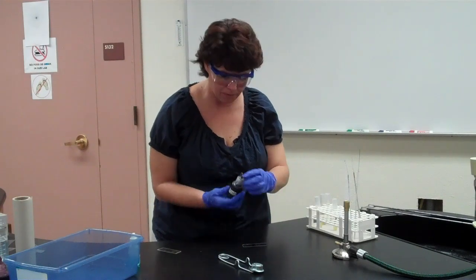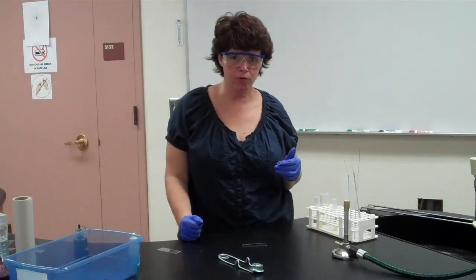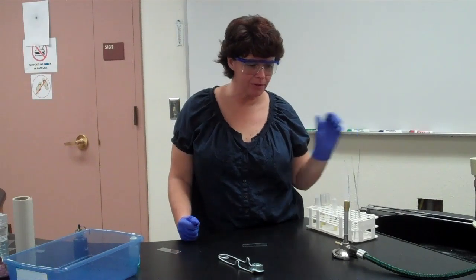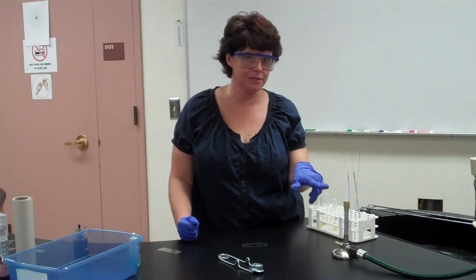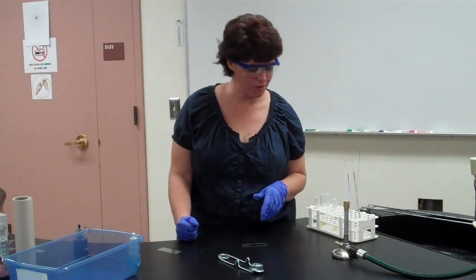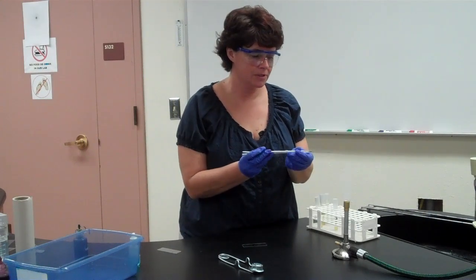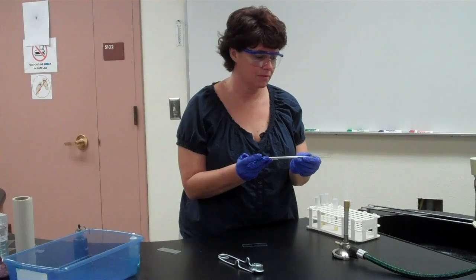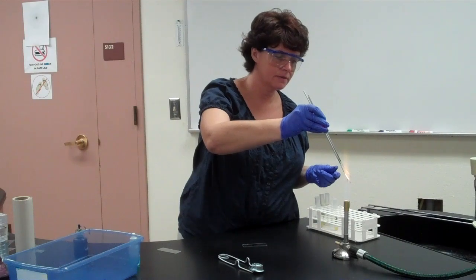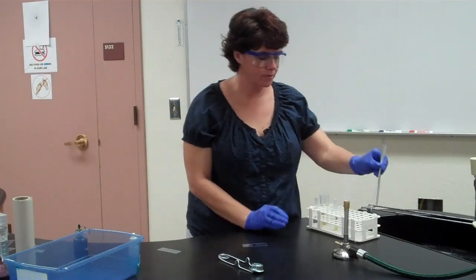A couple of drops should be fine — we don't want to overdo it; one is probably plenty. It says to add three loopfuls of bacteria, and you have to do it aseptically. In the interest of efficiency, why not sterilize all three loops at one time and have them ready? As long as you don't set them down they'll still be sterile. I'm going to sterilize all three together — make sure they all get red.